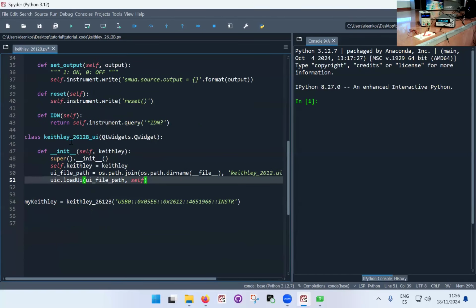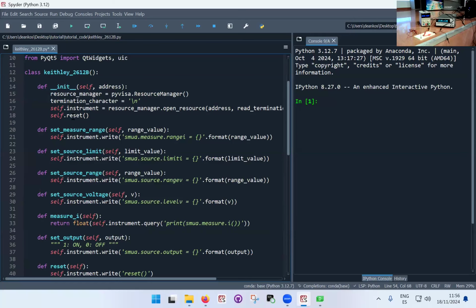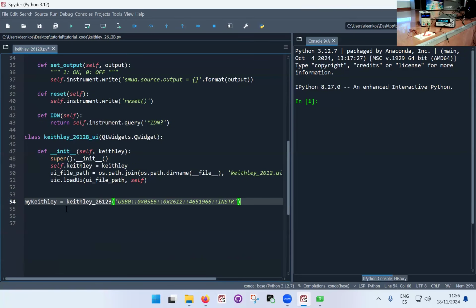We've now created the preliminary class. So this will, in principle, connect the user interface file that we created. And now here outside, when I execute a piece of code, Python will sort of pre-compile the classes that I defined, but then the actual code that gets executed is this thing that's here at the bottom. So if I remove this line, the code will run and will not do anything, actually will not create anything. So in this case, I'm going to put here all the few lines of code that are actually necessary to start the so-called Qt application, which is kind of the engine of the user interface. Again, it will be a few lines of code which are a little bit technical, but that's kind of what you need to get this all up and running.